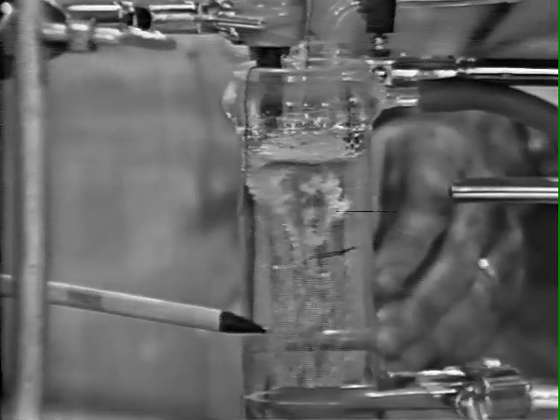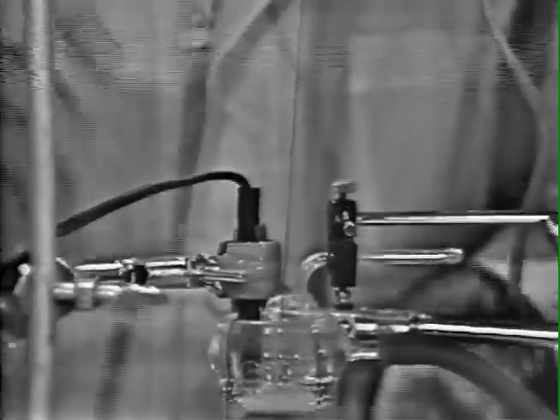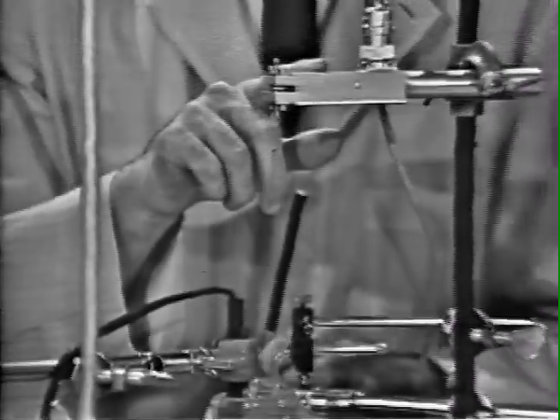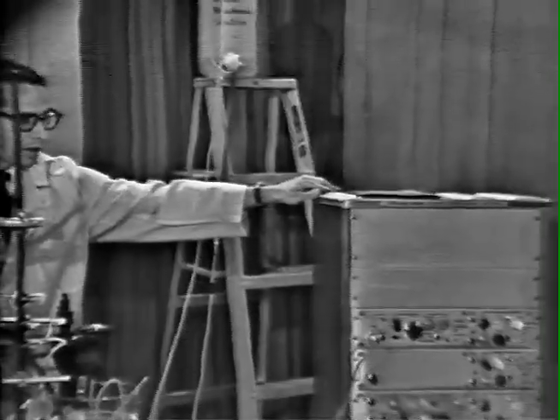The bottom atrium is tied to a stationary glass rod, and the top is tied to a string, which is then connected to the force displacement transducer. This transducer, in turn, is connected to the polygraph, where we obtain a readout of the atrial force and rate of contraction. There appear to be arrhythmias, although often these convert into normal atrial contraction with time.